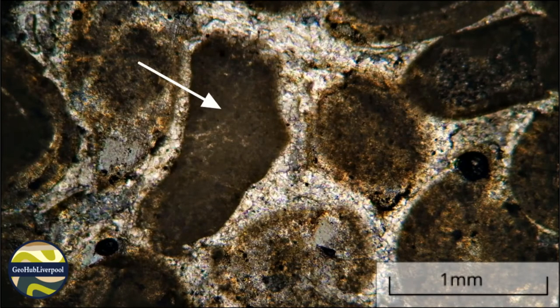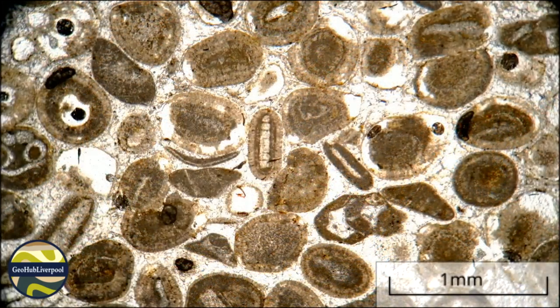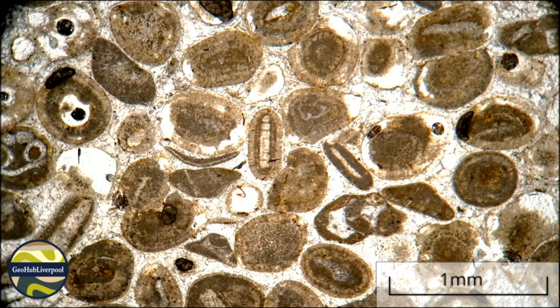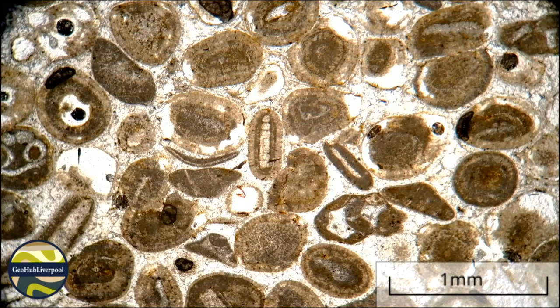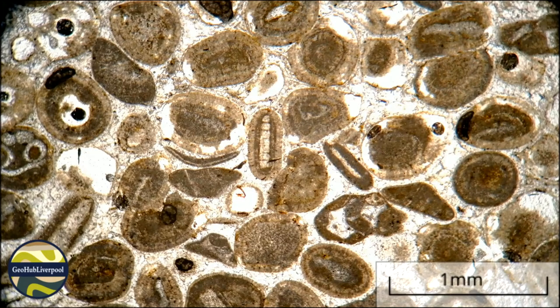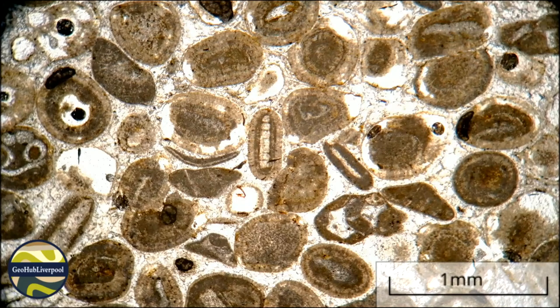In summary, this sedimentary rock is limestone. It is largely composed of non-skeletal grains held together by sparry calcite. It is an oolitic limestone. Under Folk's classification of limestone it would be named oosparite, because it is composed of ooids cemented together by sparry calcite.